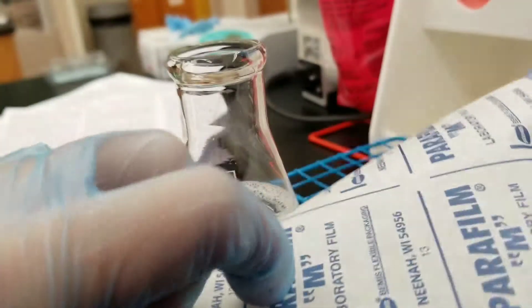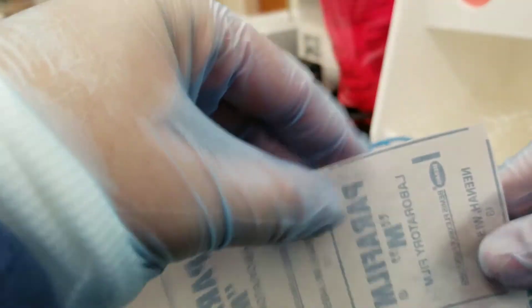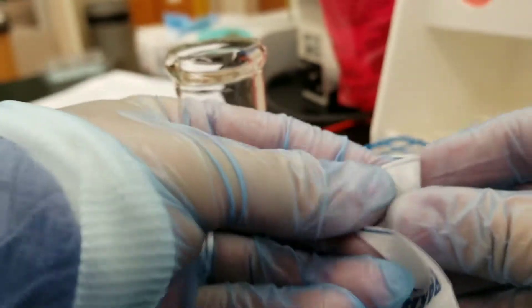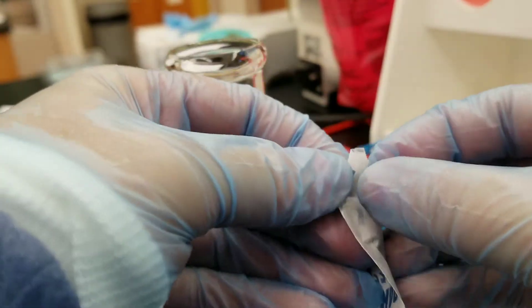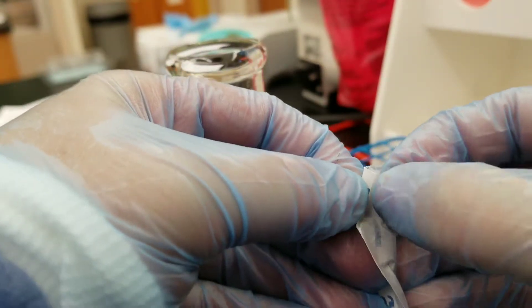It's got the label on the back and then the parafilm's right there. You have to separate it in order to use it to seal something off.